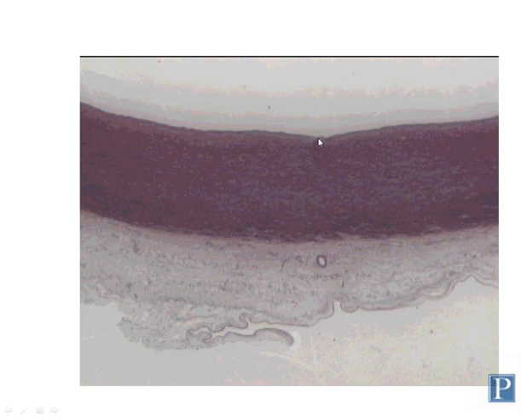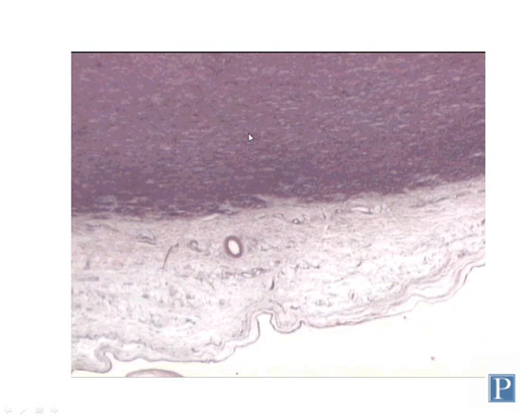So this particular blood vessel is so large that the entire section won't fit on the slide. So you only have part of the wall here of the aorta, which has basically been flattened out. Here's a higher magnification view of the interface between the tunica media here and the tunica adventitia or tunica externa. And on this particular slide, you can see that there are actually blood vessels of various sizes, both veins and arteries, or arterioles and venules, within the tunica adventitia.